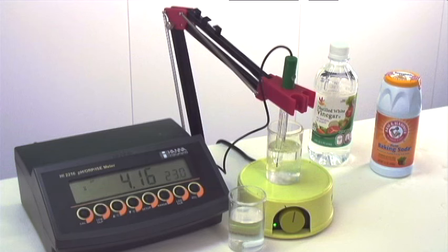With the second drop, we're approaching a pH of 4. The pH of the vinegar is around 3, so we're going to see how many drops it takes to drop below a level of 4 pH.